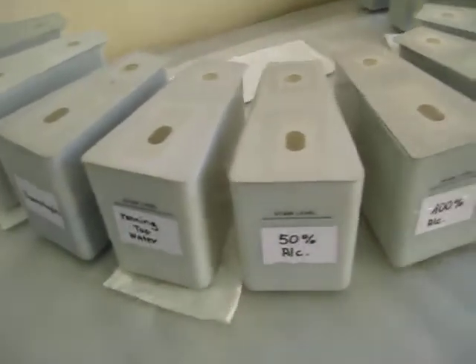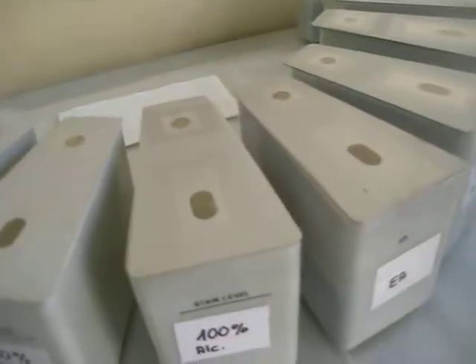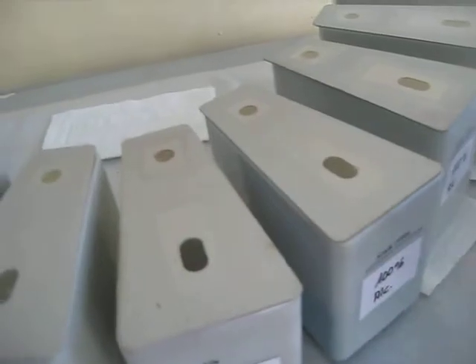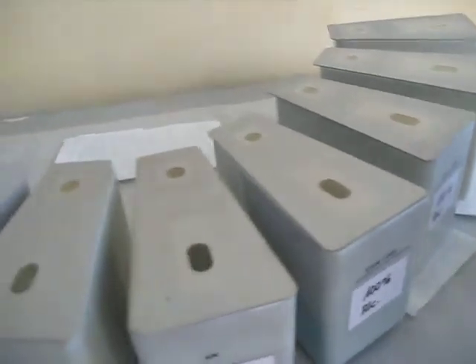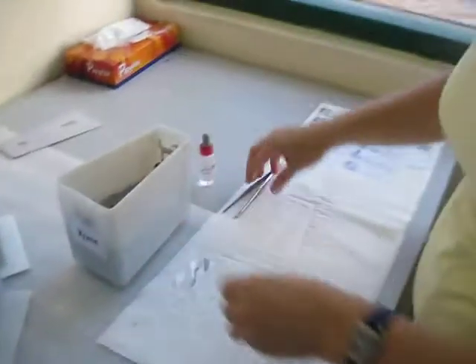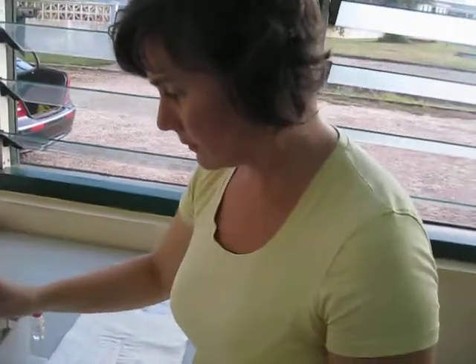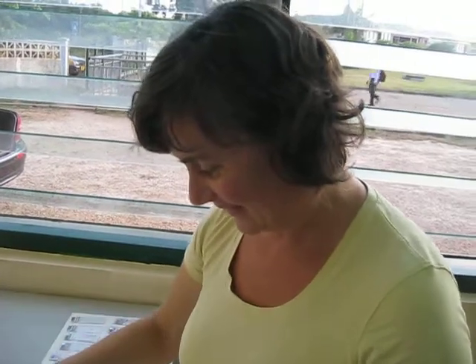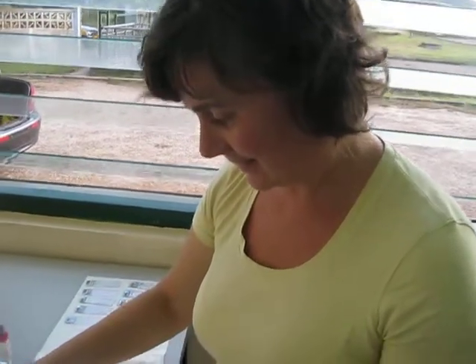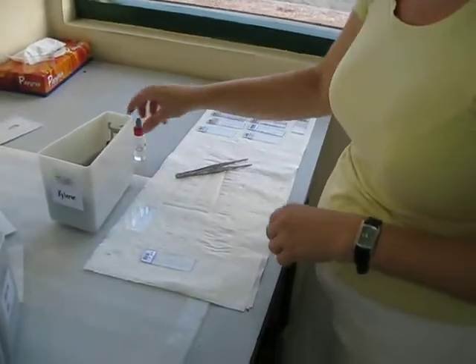Some stations, especially those with the alcohols and the xylenes, can be collapsed depending on the amount of xylene or absolute alcohol you have available. At this stage I'll introduce you to Kizila Kaufman — she is the one who helped us set up this lab; she's from Germany, and she's going to demonstrate how to cover slip one of the slides.